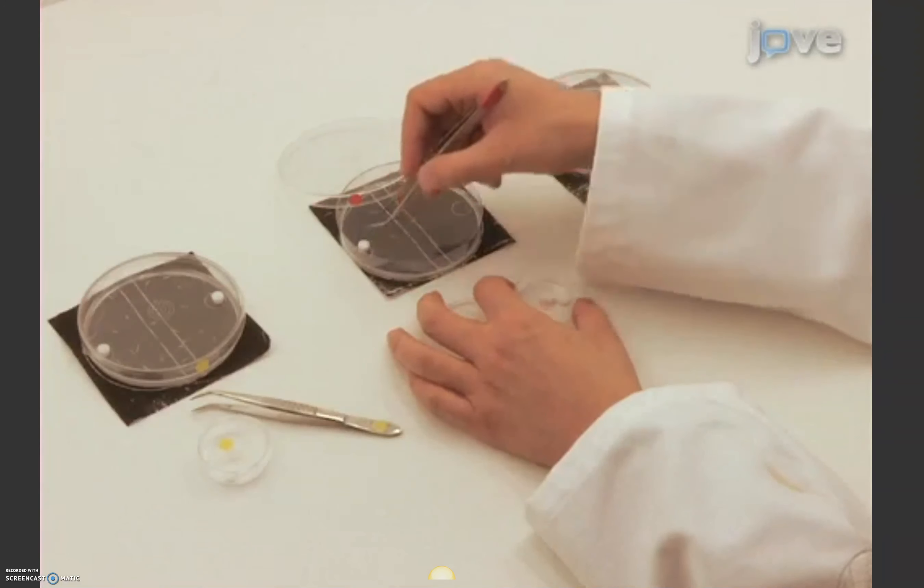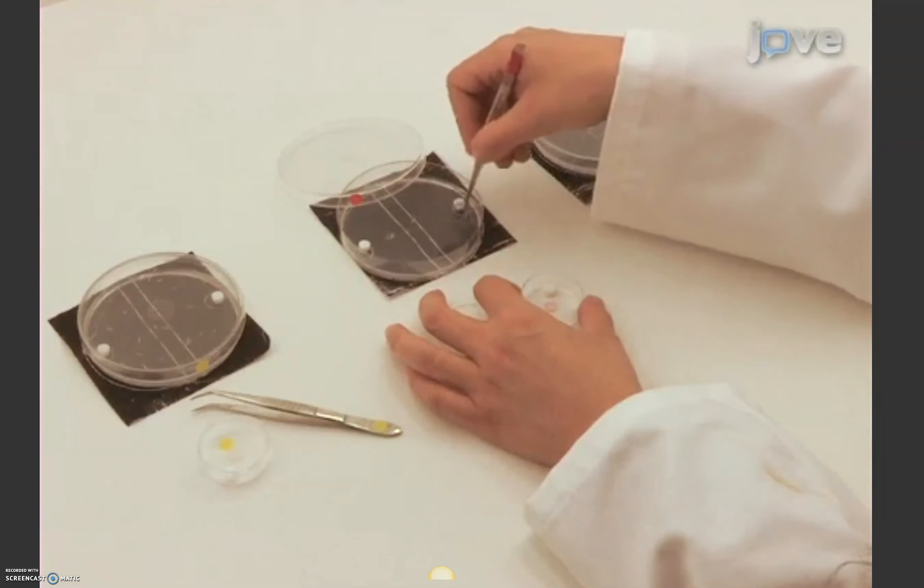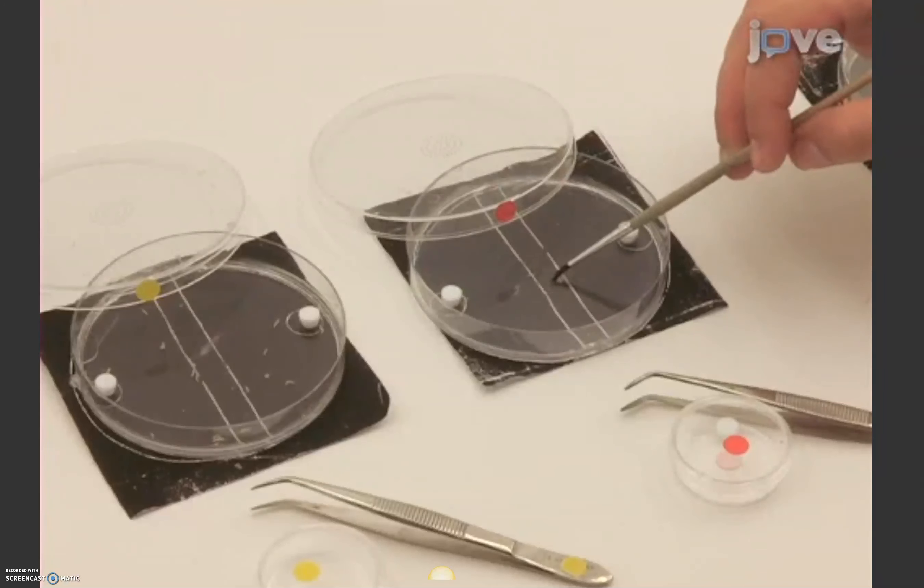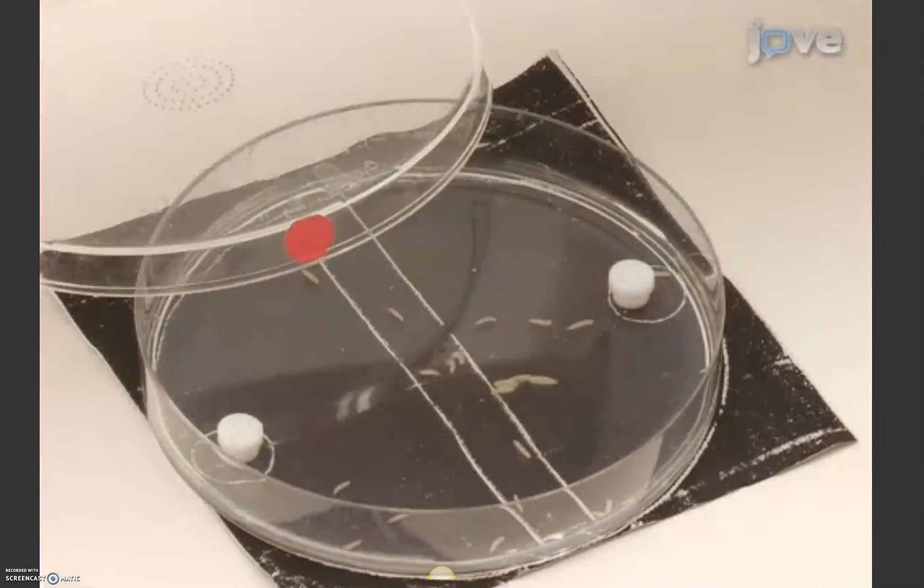Put a new container of amyl acetate onto a fresh petri dish. After 5 minutes, use a moistened brush to transfer the larvae to the opposite type of dish, with the opposite stimuli located on its left and right side. So the odor here is amyl acetate.